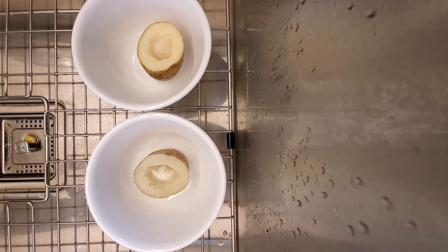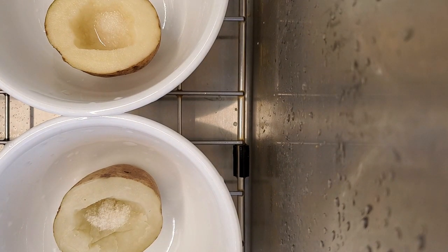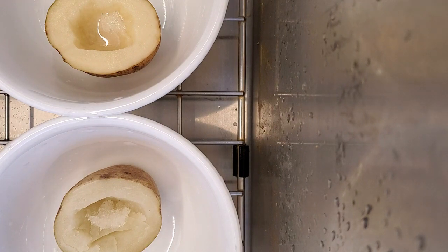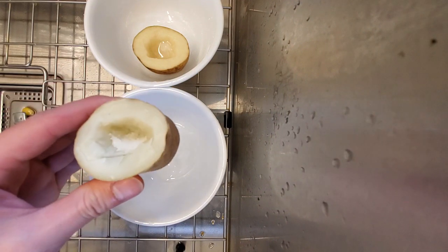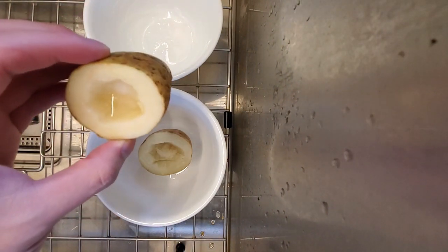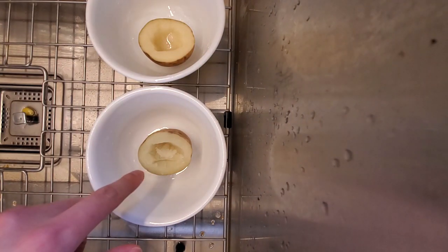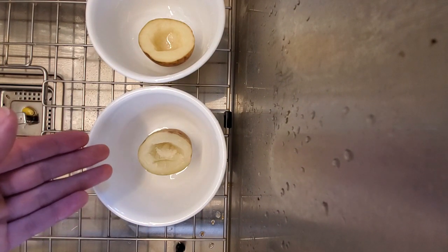Now I'm going to pause and fast forward, and we'll see if the water diffuses. Okay, and now we're back. If we look at the potatoes - this is the one that was boiled, and as you can see it's very dry. There's no water that came out of it. And this is the potato that was not boiled - you can see water came out. So how come water came out of the potato that wasn't boiled? The potato that was boiled has cells that are all dead, and if the cells are dead, the cell membrane is not working correctly, so salt would not cause the water to diffuse from high to low concentration.